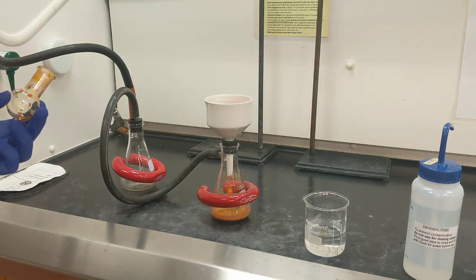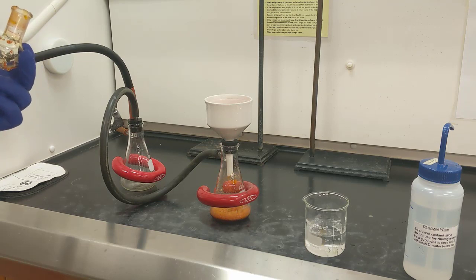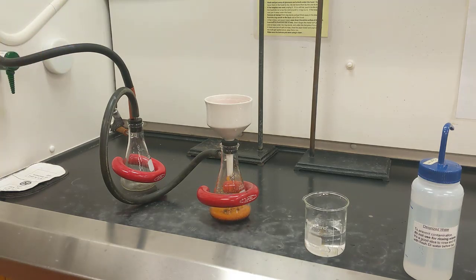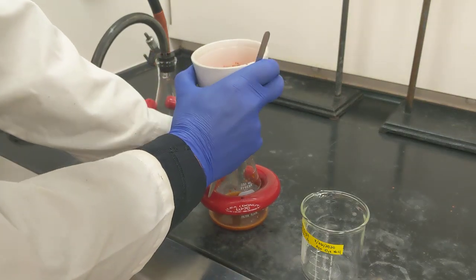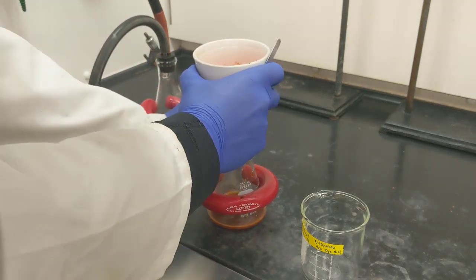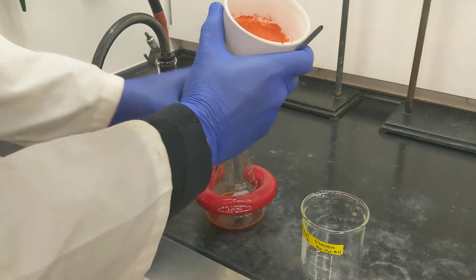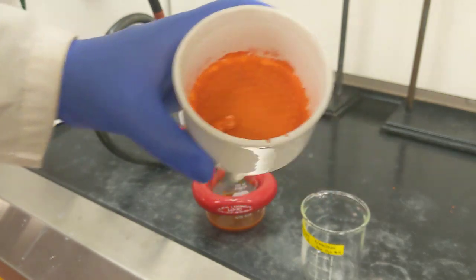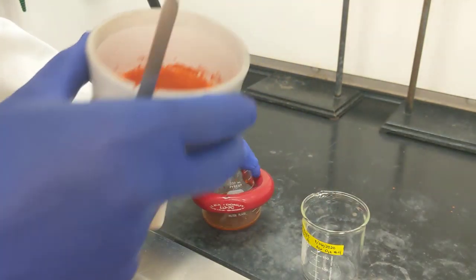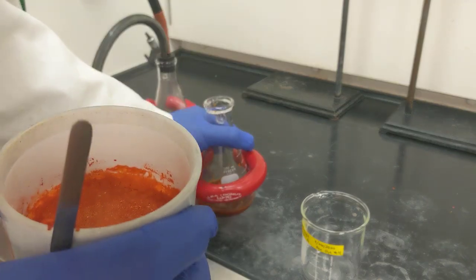All right, so that looks pretty good. I'm going to let it air dry for a couple of minutes, and then we can take a look at what color the crystals are that we made for our Azo dye. All right, so I've let this vacuum filter for a while to let it air dry a bit more. Now let's take a look at our solid Azo dye product. All right, so if we look down in here, you can see that the Azo dye is this sparkly orange color, which is kind of cool. The filtrate, if we look at that a bit more closely, is more of a dark red orange and more or less the same color.